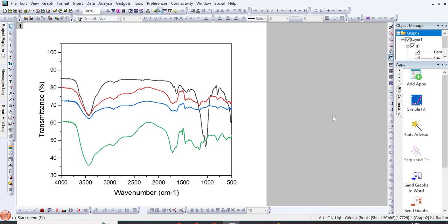Have you ever faced difficulty in plotting FTIR spectra with some overlapping lines like this? For example, if you have multiple data sets for different materials and you want to plot the graph, either FTIR or XRD graph or TGA for those data sets, and when you plot a graph in line form, then these lines get overlapped or merged with each other. So how can you justify the result obtained, how can you differentiate between their results, and how can you create equal distance between these lines?